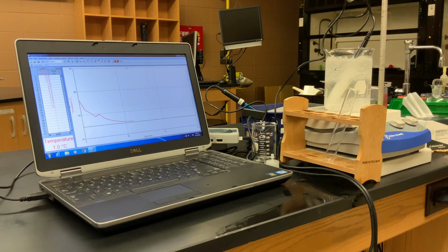So we got another reading at 1. So this time our difference in temperature was 0.1 degrees Celsius. So at our 13-minute mark, we're at 1 degree Celsius, and of course we're still in the solid state. So we know from this point we have solid biodiesel. We're just trying to narrow down the melting point. We're going to take another reading. We're at 0.9. So you can see now that our change in temperature is getting very, very small, within 0.1 degrees Celsius differences. So we'll take another 1 or 2 readings, and then we will settle on that final temperature reading as our freezing point.